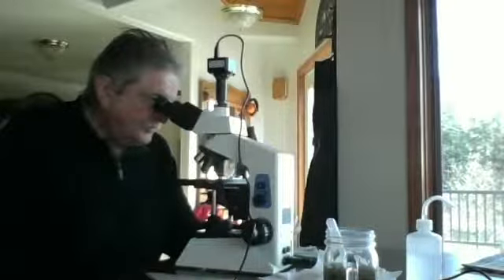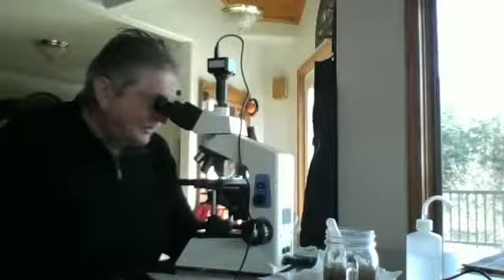A lot of moving alive bacteria in here for sure, mostly cocci, and some long bacillus, and some what I'm not used to seeing, are some very fast moving 1 micrometer bacteria, just moving all over the heck.